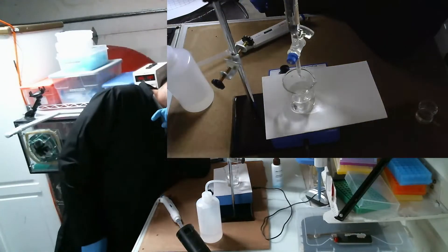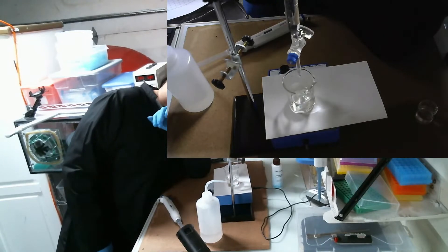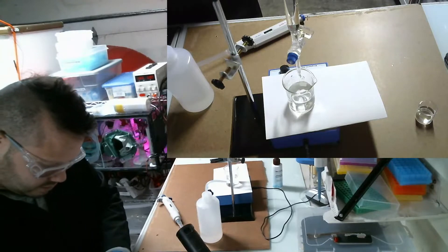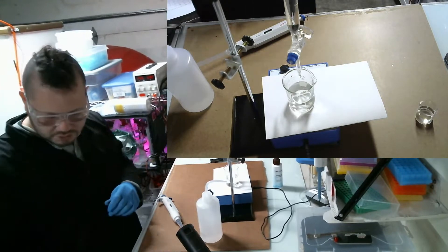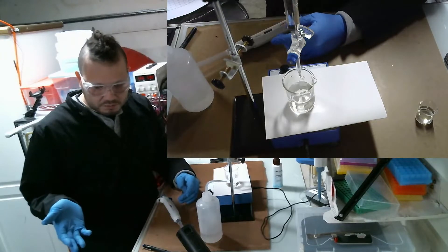Let's see what we got - we got 88.8. Now I only used about 2.7 milliliters. Now what I have to do is plug that into the formula.